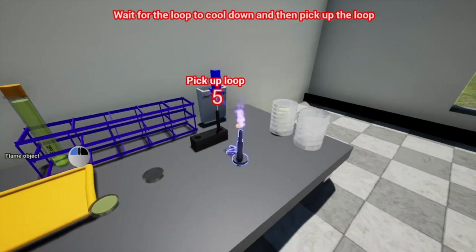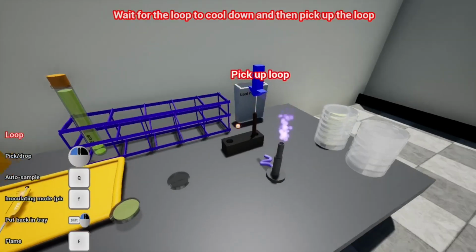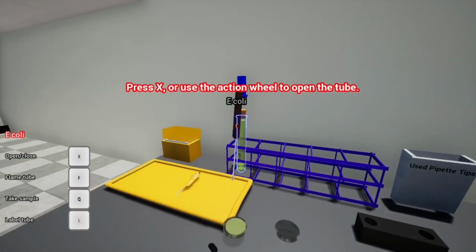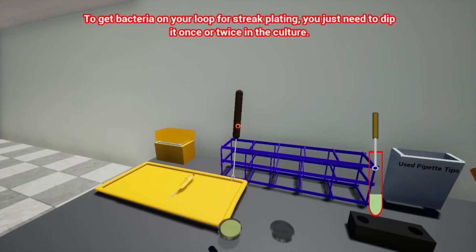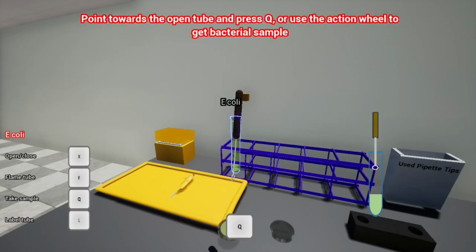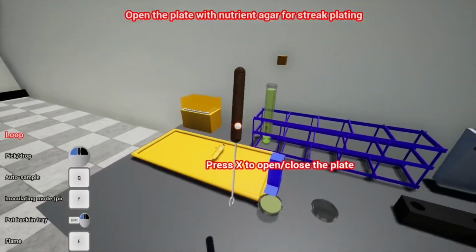Wait for the loop to cool down, and then pick up the loop. It's gonna cool, 3, 2, 1, yay, it's cooled. Press X or use the action wheel to open the tube. So I'm gonna press X. Every time you open or close a tube, you should always flame the opening to minimize contamination from air. Pressed F. Again, to get bacteria on your loop for streak plating, you just need to dip it once or twice in the culture, point towards the open tube and press Q, or use the action wheel to get bacterial sample. So let's press Q. Open the plate with nutrient agar for streak plating.